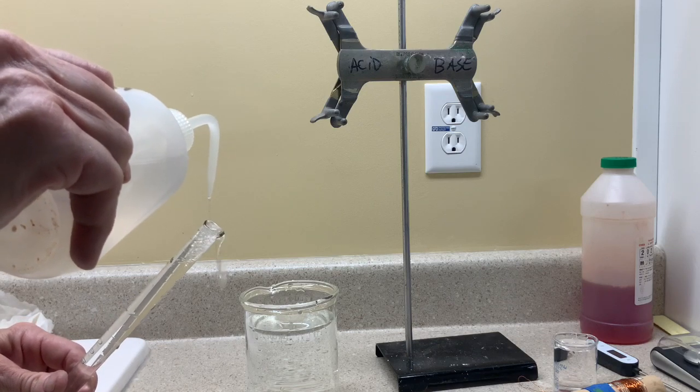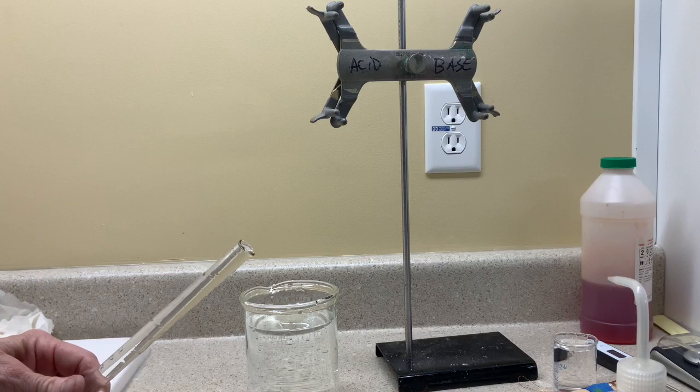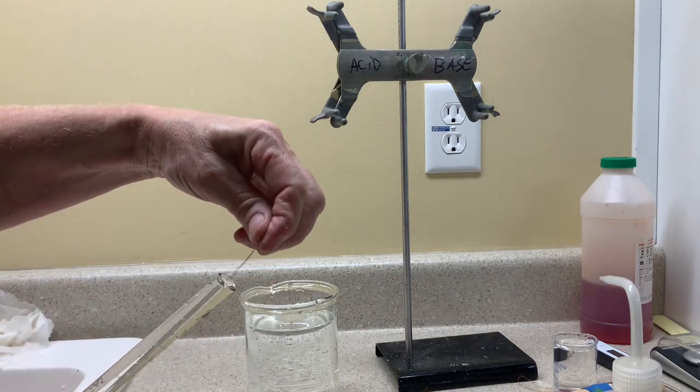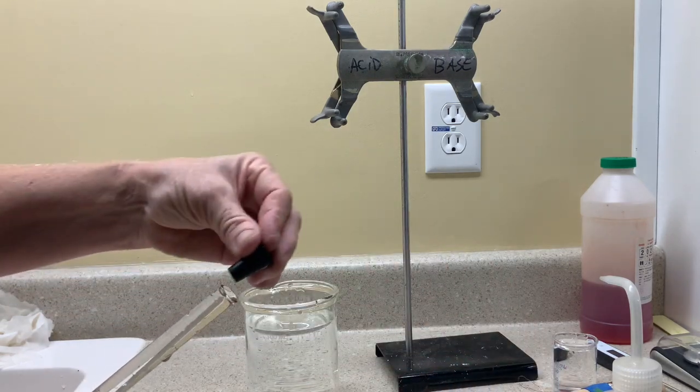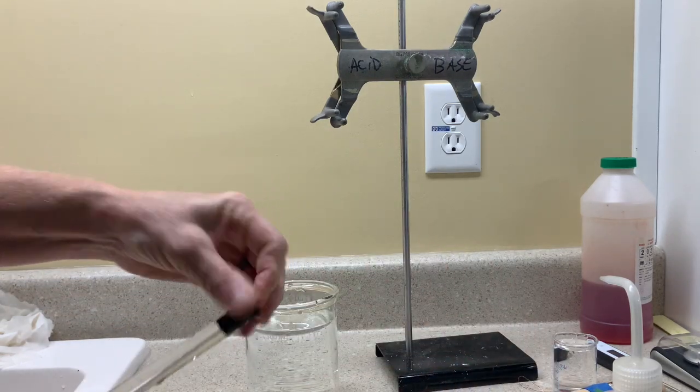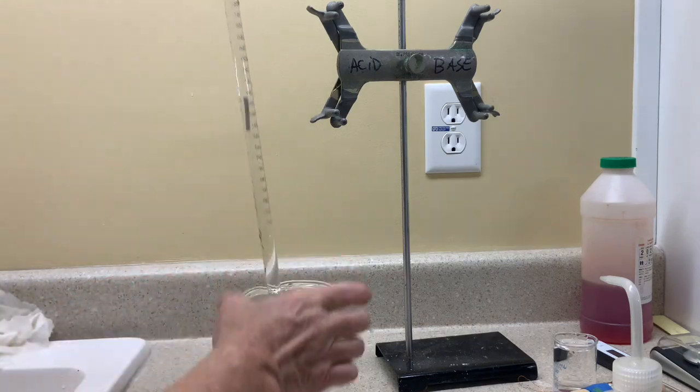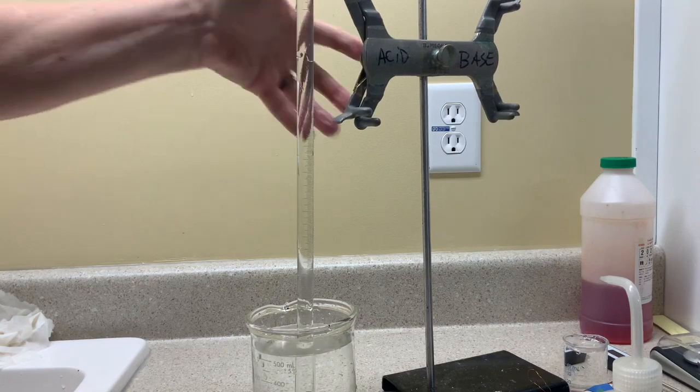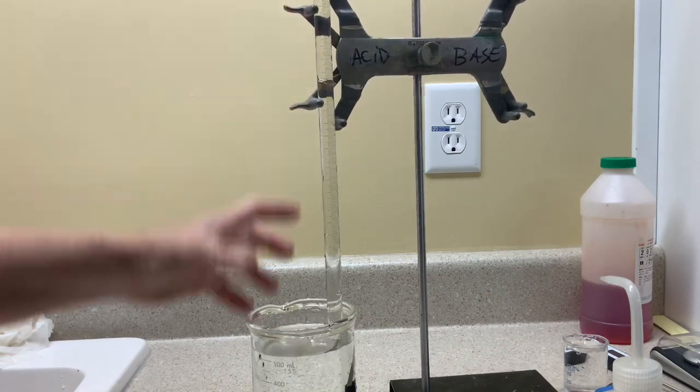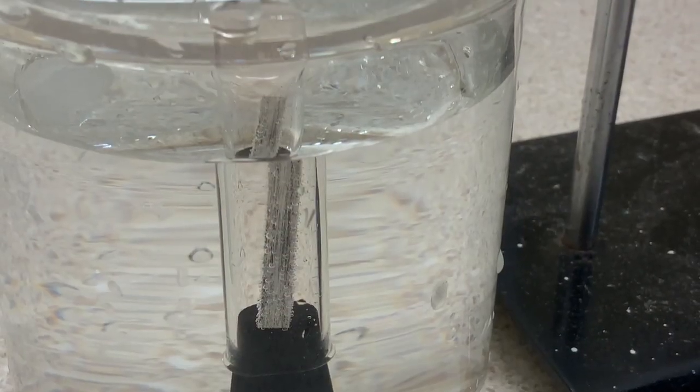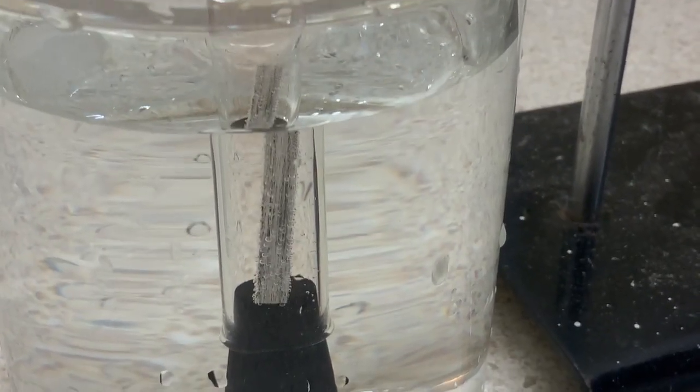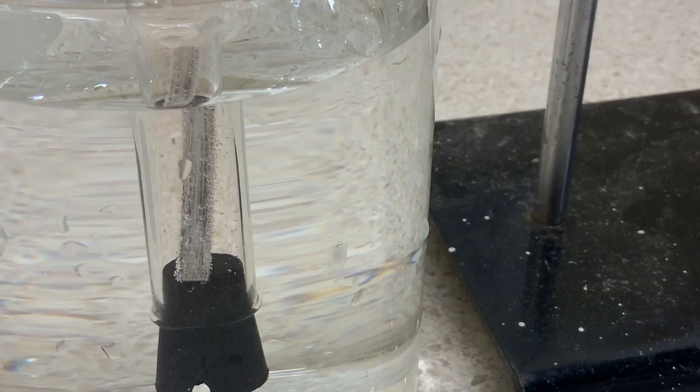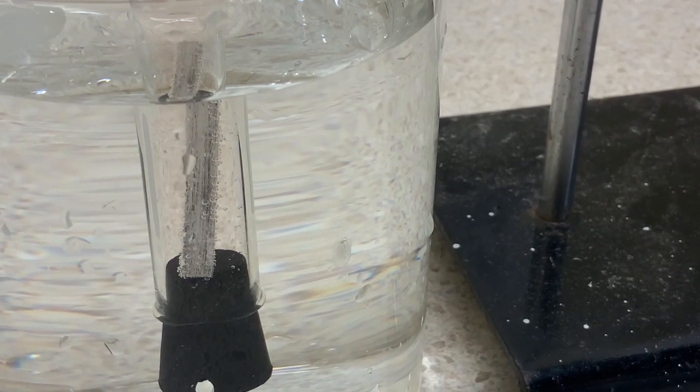Okay, putting the piece of magnesium in the top of the eudometer. Uh-oh, it's sinking down. Better hurry up; don't want it to fall all the way down and react. Turn it upright; you can see the magnesium comes back to the bottom. Whew, no reaction started yet. We averted that possible disaster. So take a look and watch; the issues aren't over yet. There may be some more problems that result from the magnesium not being held in place.